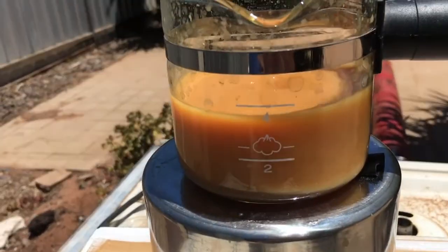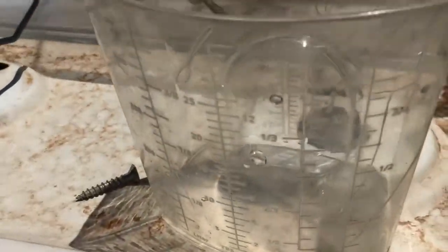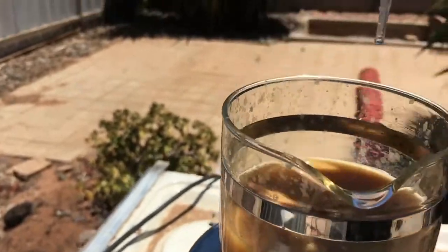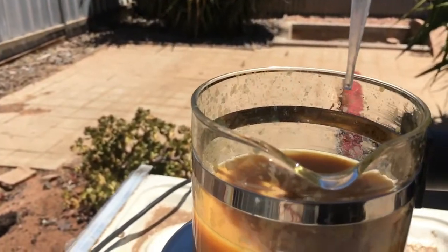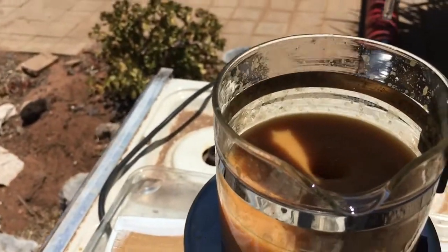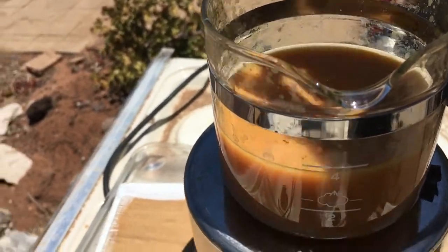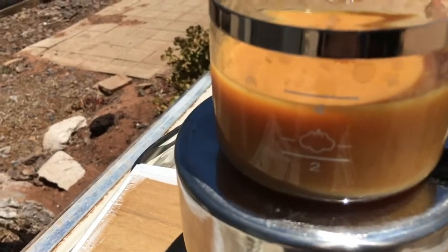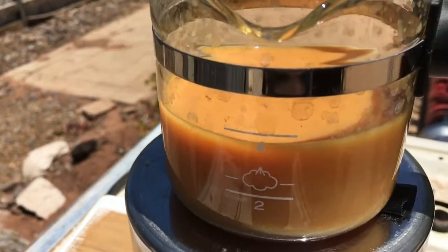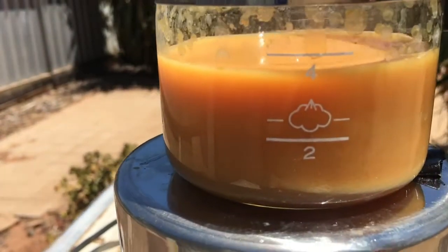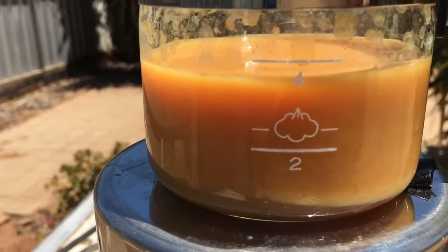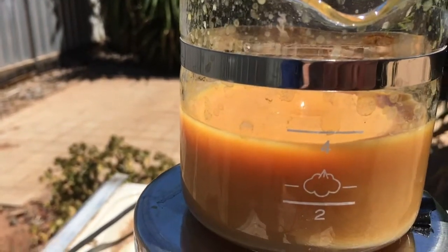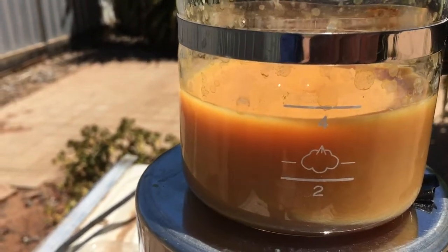It's been an hour and 40 minutes. And I have all the zinc sulfate in the solution. I was holding it up about there, dropping a drop every time it hit the liquid. So I'll let that stir for about an hour or something. It's a nice orange colour. We didn't get the blue like I did with the metal stir bar. So I think it was successful. And we'll get it in some filter paper and see what we get.